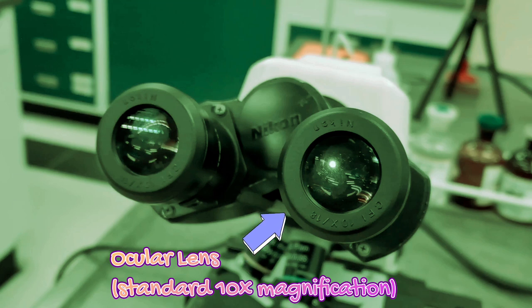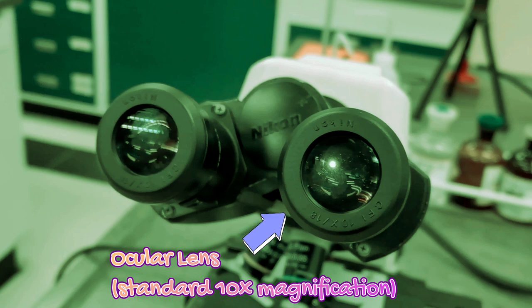Next, this is the ocular lens. This is the lens which you will use to look right into your specimen. The standard magnification for this lens is 10 times.